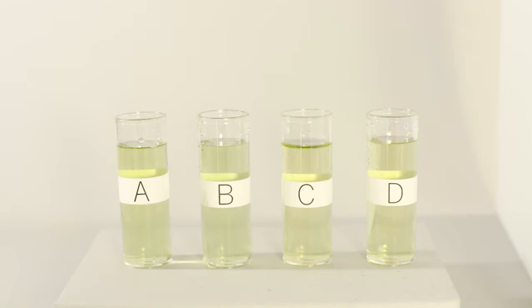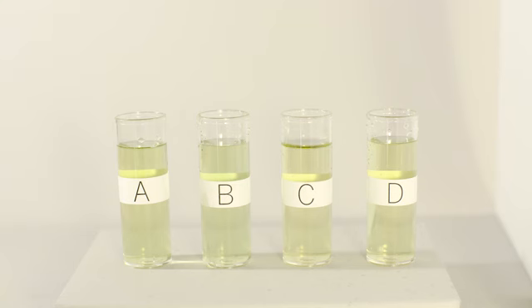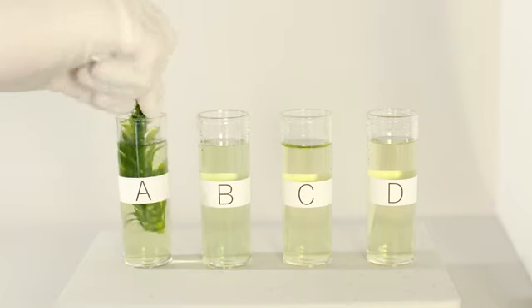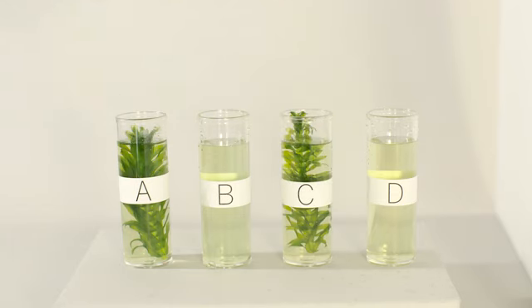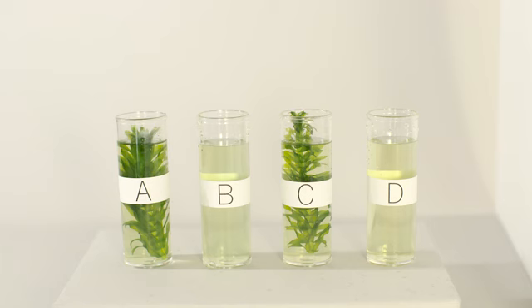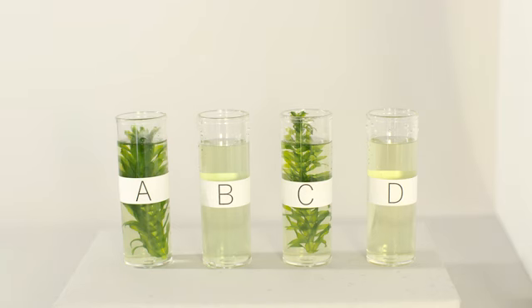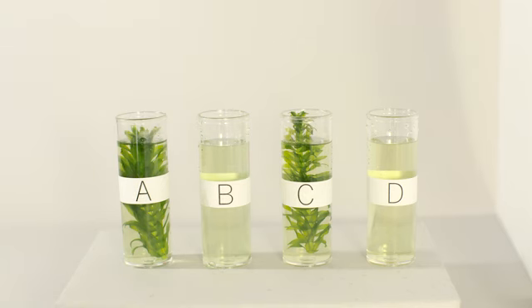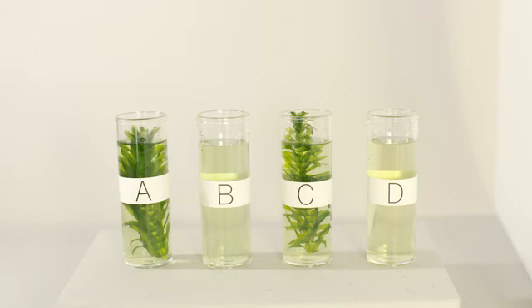We're going to do an experiment to test the effects of light on photosynthesis. To do this, we start with four vials filled with water. We'll put a water plant called Elodea in two of them. We know plants take in carbon dioxide during photosynthesis, so to find out whether a plant performed photosynthesis, we can look at how much carbon dioxide is in the water around it. The water in these vials contains an indicator chemical that shows the level of carbon dioxide in the water using color.